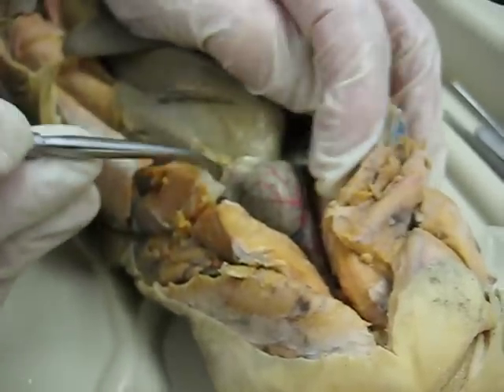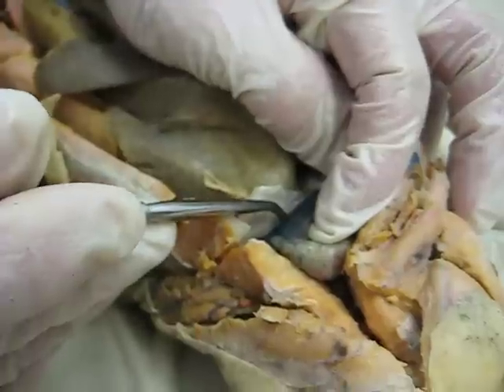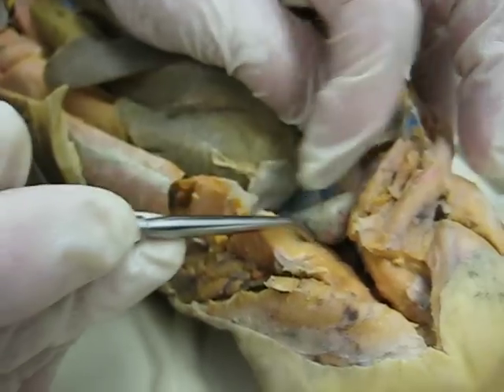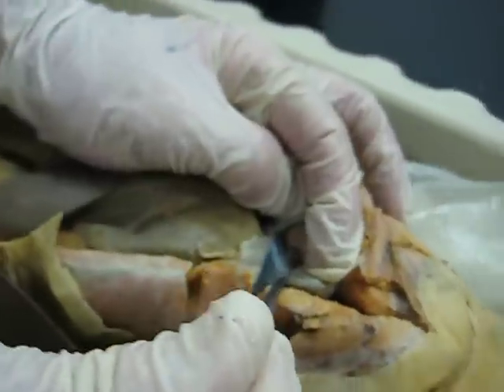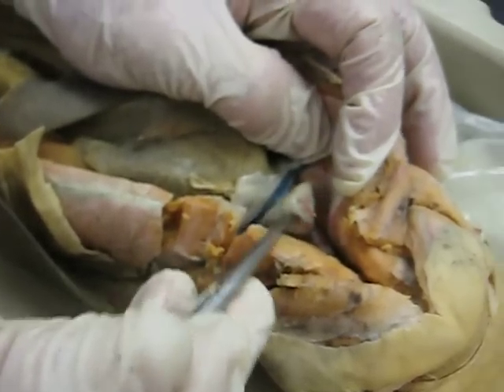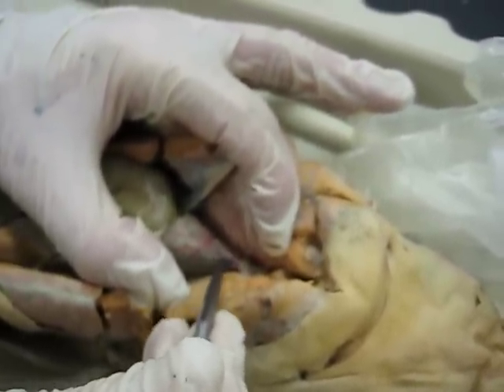The various parts of the heart, from posterior to anterior: the middle area that's sac-like, if you lift up the ventricle, is the sinus venosus. Blood would be flowing into a bilobed atrium — there's one lobe over here and another lobe here — and then from the bilobed atrium into the ventricle.